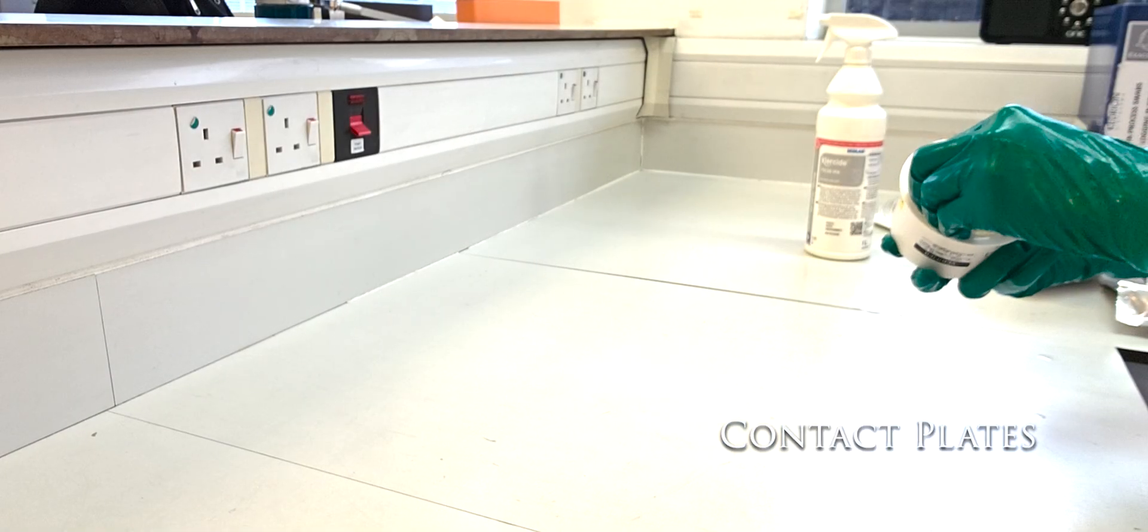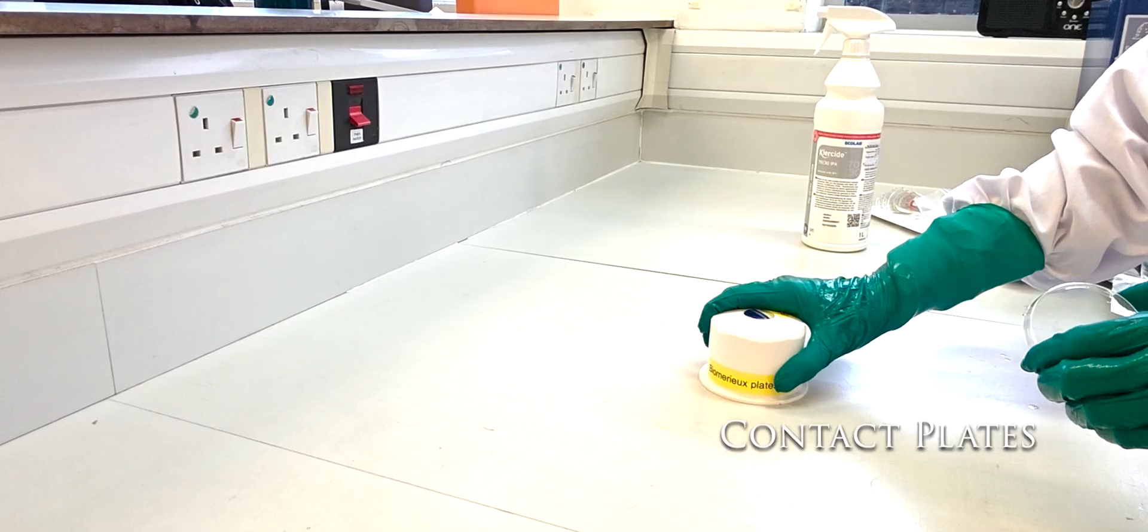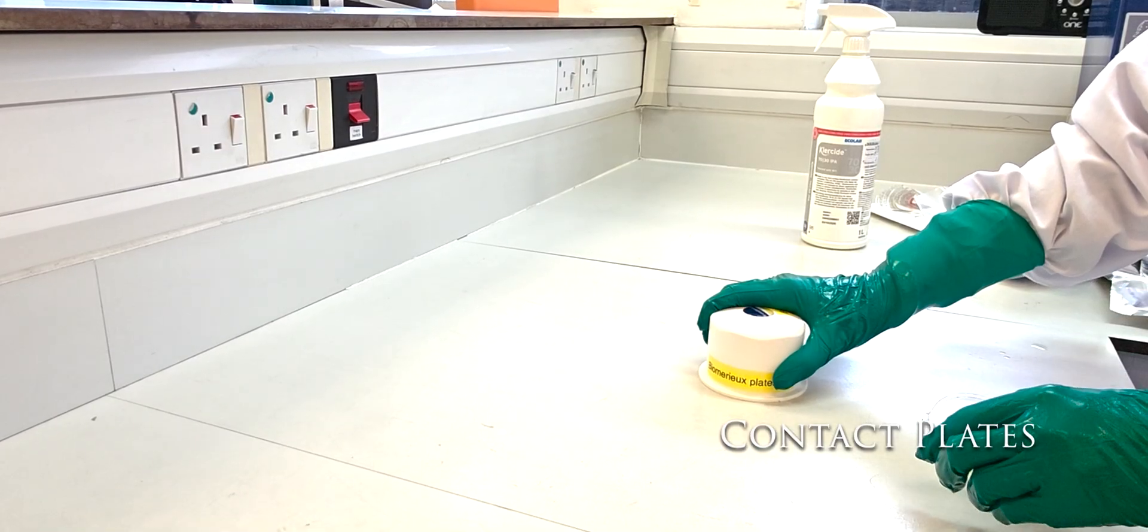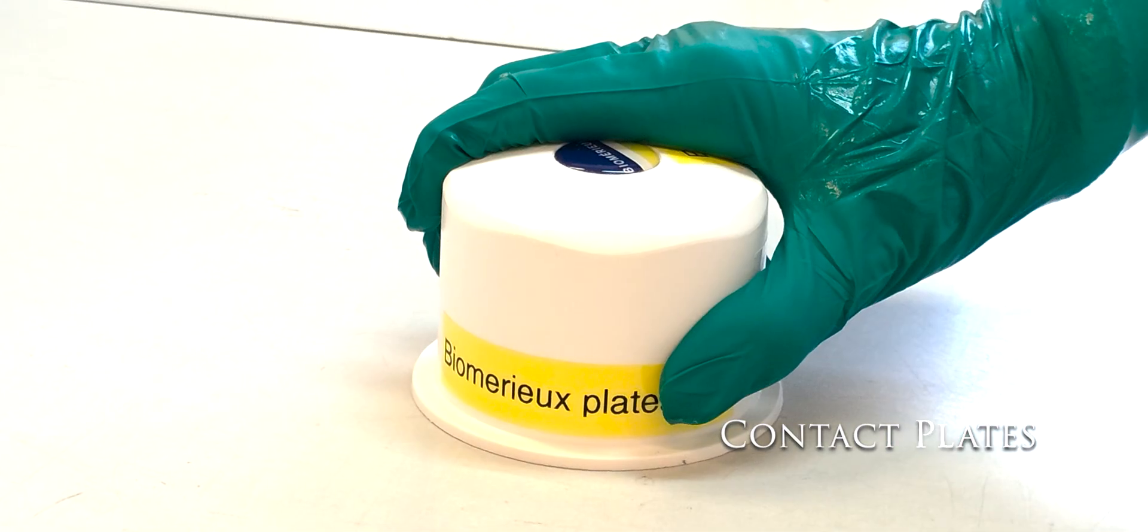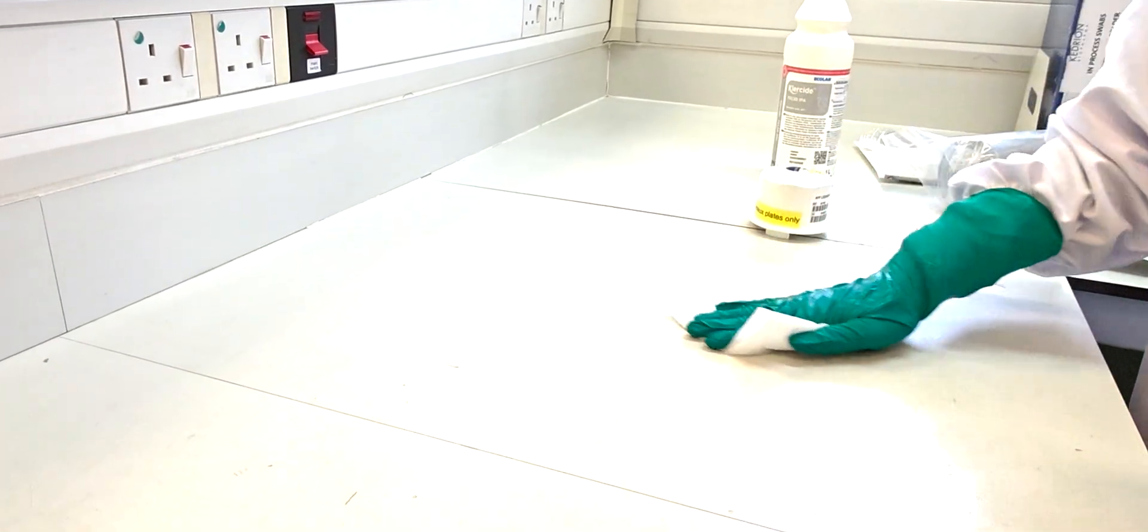Always use applicators for contact plates. These help you to press the plate onto the sampled surface for the correct duration without damaging the agar. You must wipe the residue of the agar from the surface you have sampled using IPA.